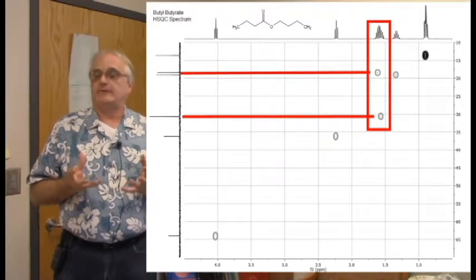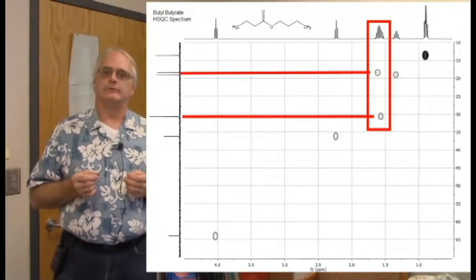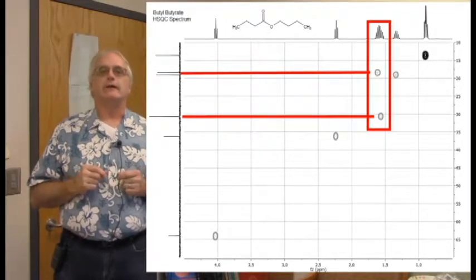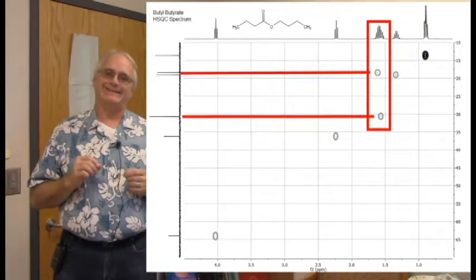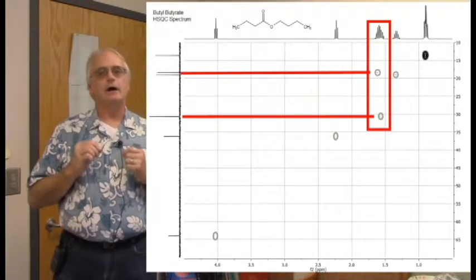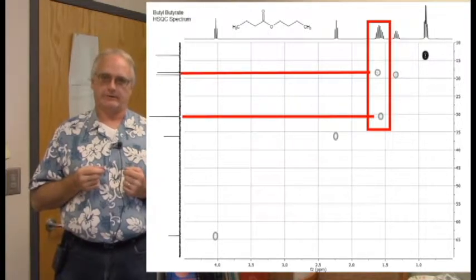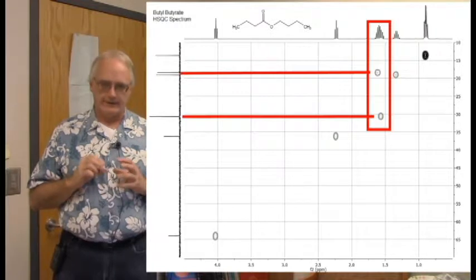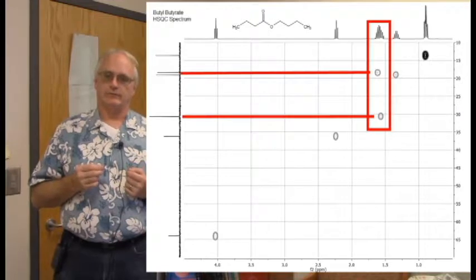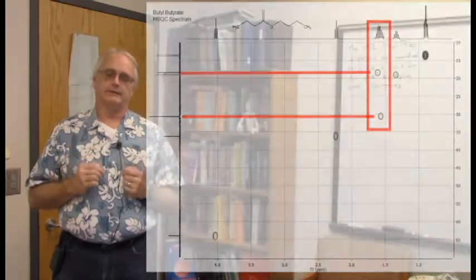4, and unless, let's face it, you're running the spectrum of methane, which is kind of a boring spectrum to run, you don't have 4 protons on one carbon. So this must be a set of overlapped signals. And indeed, it is 2 methylene groups. The DEPT 135 shows that these 2 carbons are indeed CH2 groups overlapped, giving us a complicated looking signal. It's not a textbook doublet or triplet or anything else. That is integrating to 4, 2 methylene groups overlapped. HSQC combined with DEPT 135 make that abundantly clear.